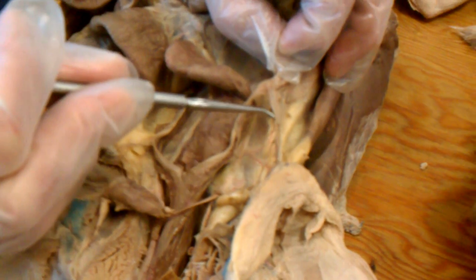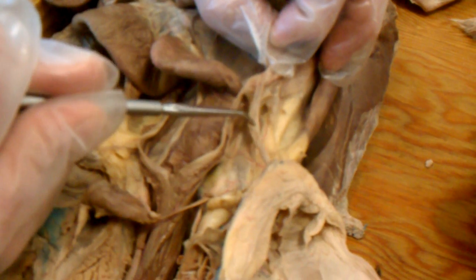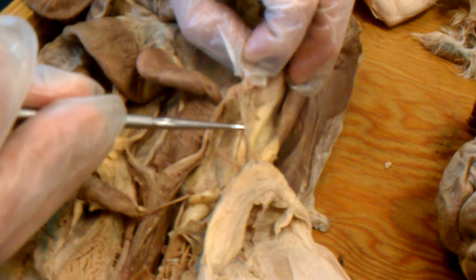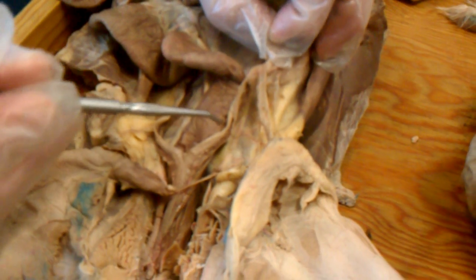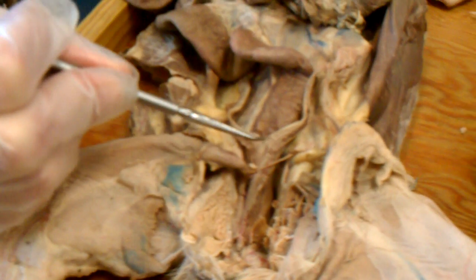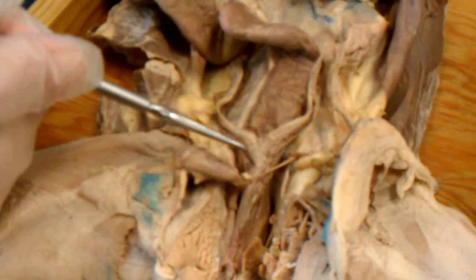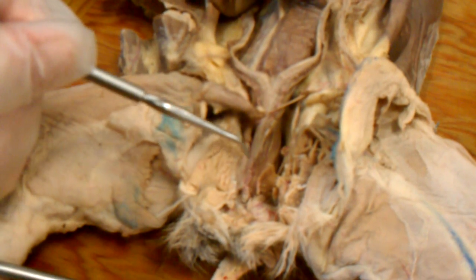Extending off to the side, like a little sail, was a second membrane. And on the edge of this membrane, there's a thickening. This is the round ligament. But again, not terribly visible here because it's been torn. At the bottom of the abdominal region, the two horns of the uterus join together. The central part is called the body of the uterus. And then from there, the reproductive structures pass through the pelvic canal.